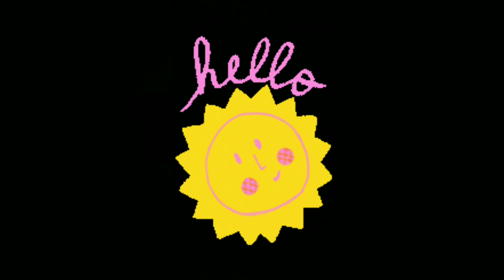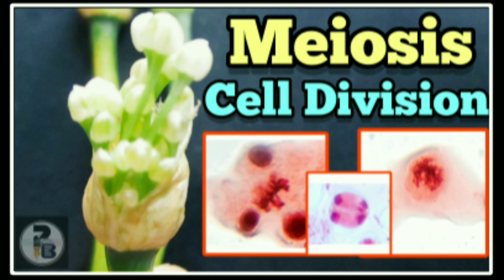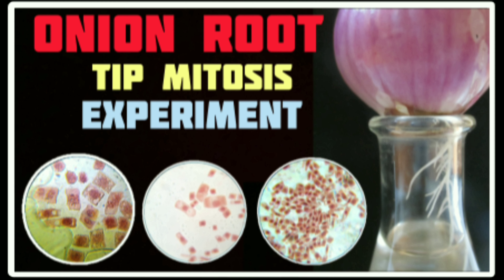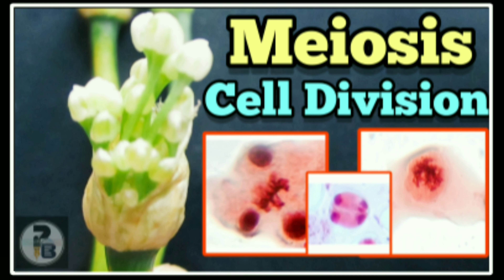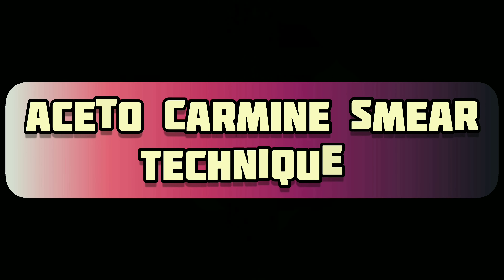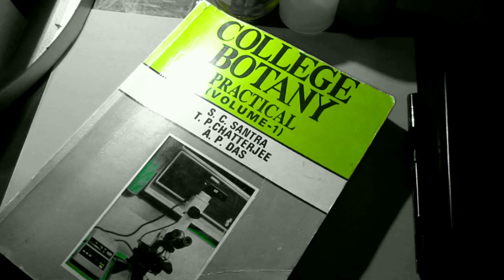Hello learners, we are back with another cell division stages live practical video. I have already posted a video on mitosis of root tip of onion — please watch it before this one. Today we are going to learn about the study of meiosis in plant material following the acetocarmine smear technique.